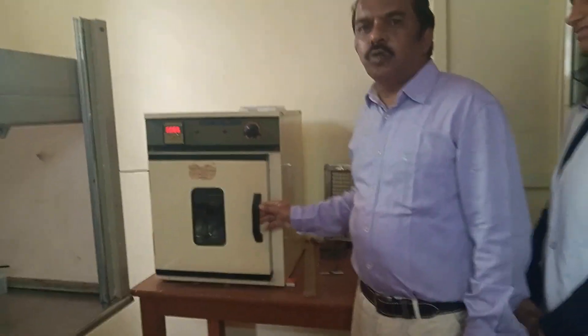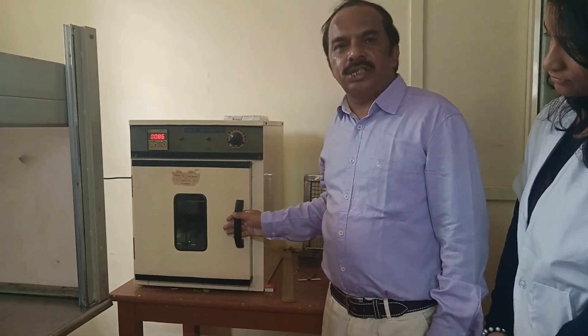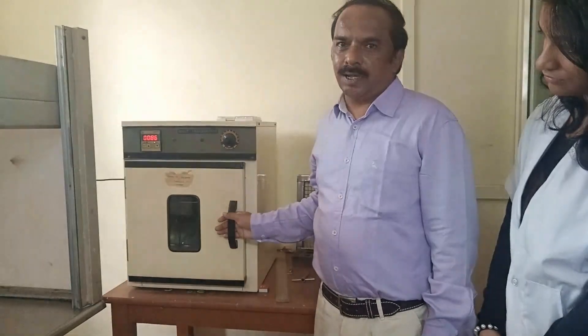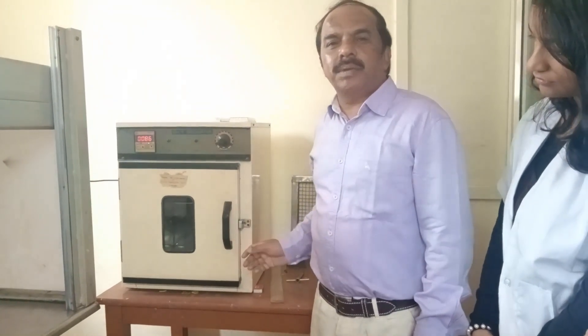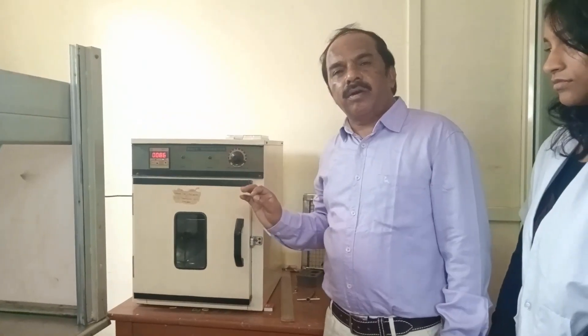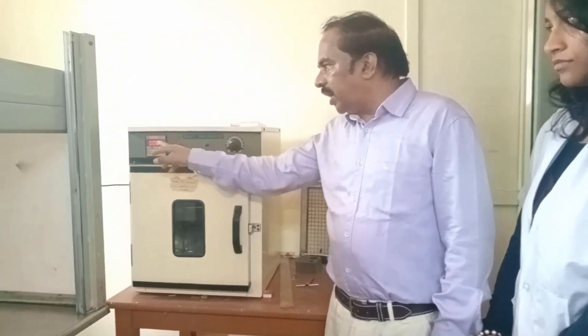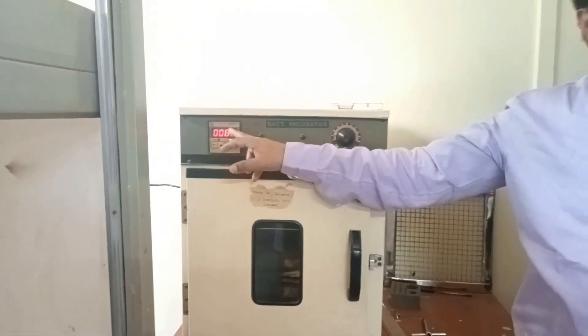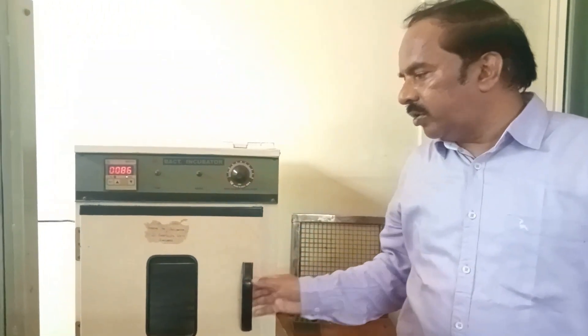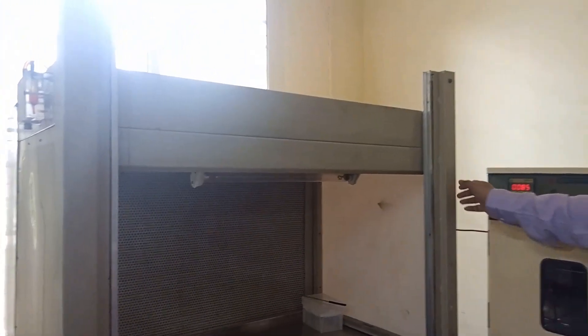This is the incubator. The incubator is used to culture bacteria, and bacteria can be maintained at any temperature of your choice. Depending on the temperature requirement of a particular bacterium, you can adjust the temperature digitally here, set the temperature, and then keep the cultures inside.